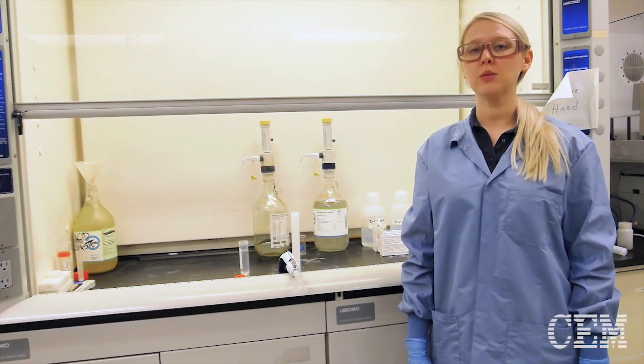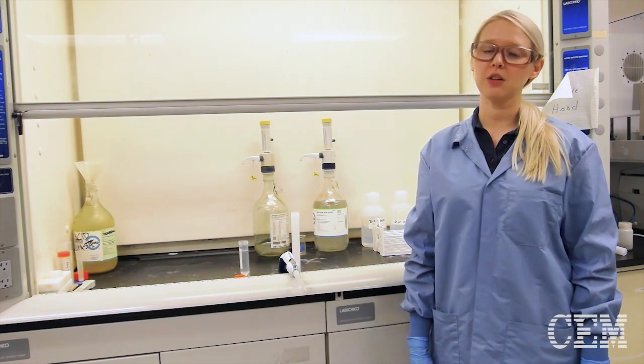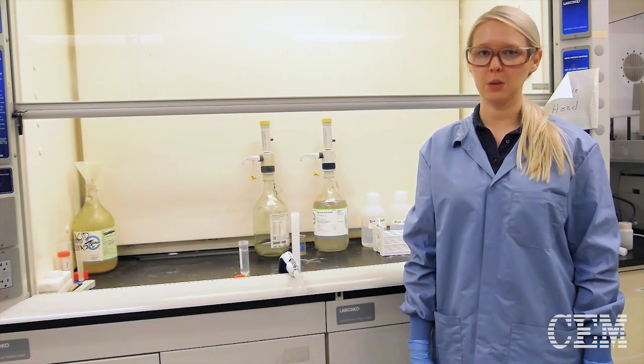When we add sample to our vessel, sometimes it gets stuck onto the sidewalls and we need to make sure it gets down to the bottom where the acid is going to be.